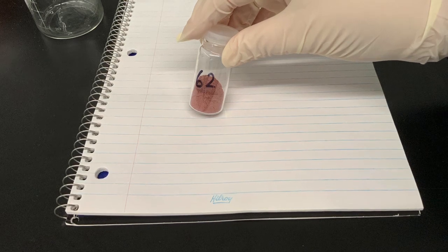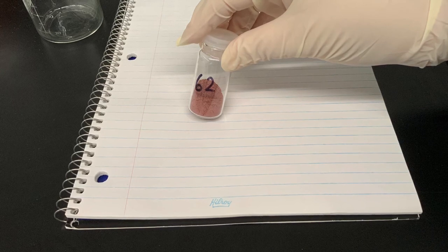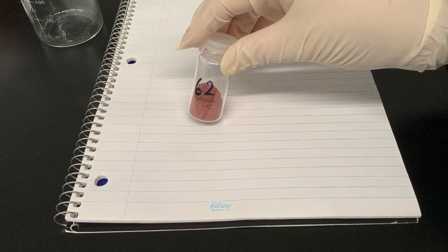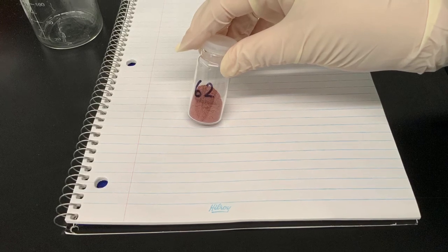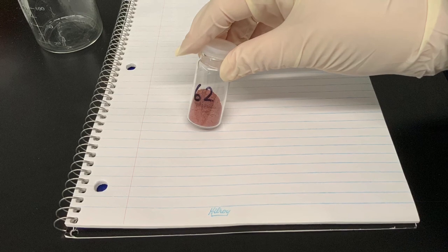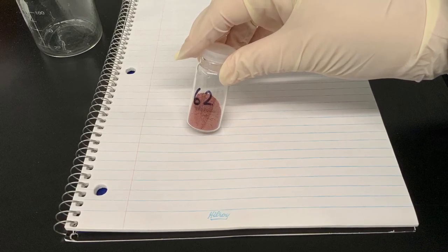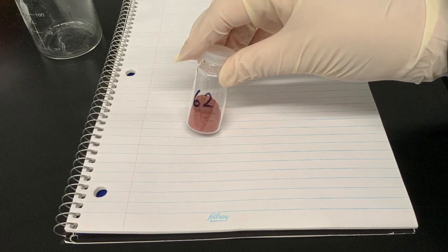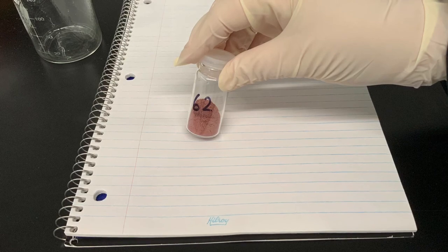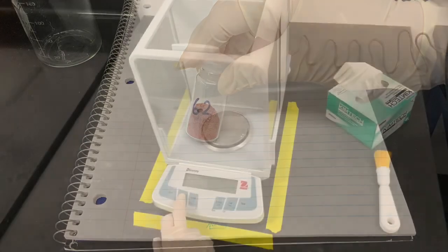For the iron spectroscopy lab, we use a scale sample. What does scale consist of? Calcium salts, magnesium salts, particularly carbonates, and the major corrosion product of the steel pipes, which is the rust, the iron oxide. And this scale sample here with the iron oxide in it has been finely ground, so it's easier to react with the hydrochloric acid to dissolve.